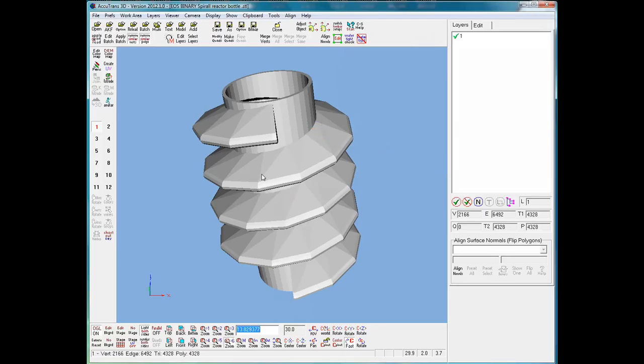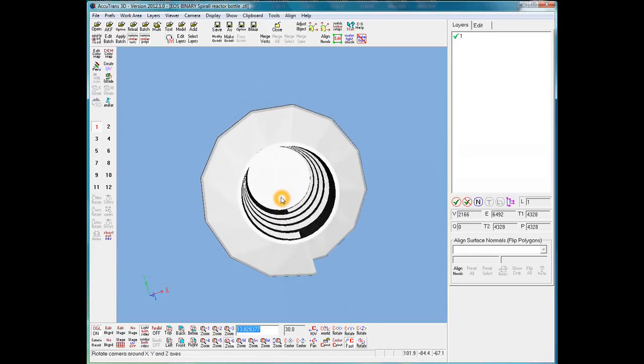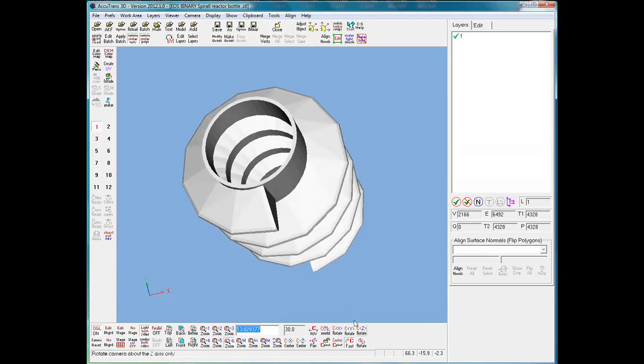the outside part of the model, but if we wanted to look at the inner surfaces, it's very hard to zoom in with the camera without getting other polygons between what we want to look at and the camera. So the easiest thing to do is to disassemble the model. Now, we know there are three places that the inner and the outer parts of the shell connect together. That's at the end of the two spirals and the circular ring at the top.